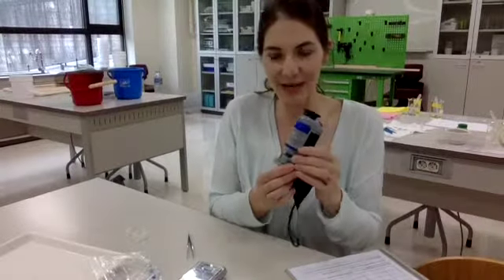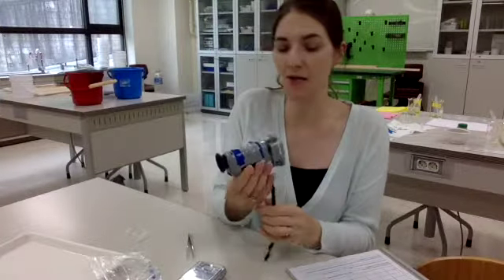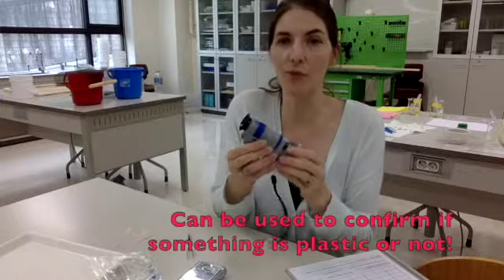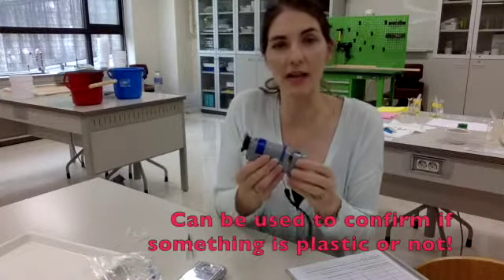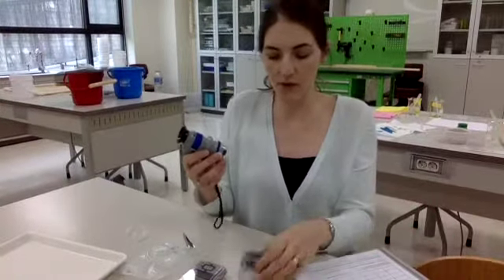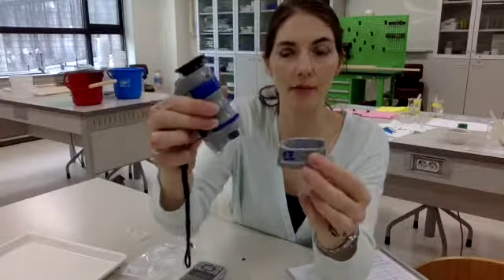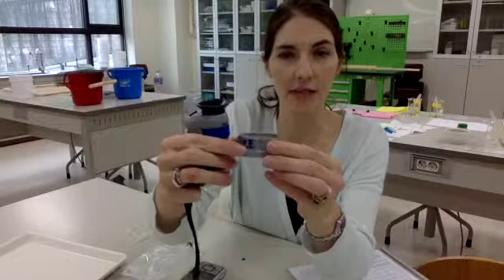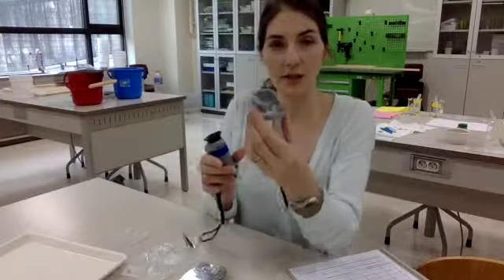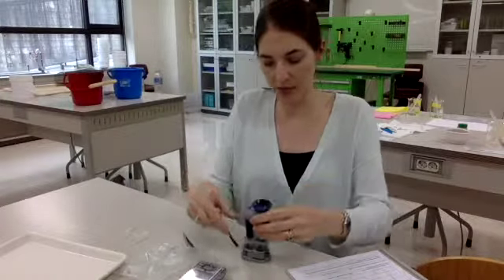The last thing that you might get to use if you want to see what your plastic looks like are these field microscopes. These are designed to look at items in the field. They're pretty hardy and can handle a lot, but we don't want to get them in the sand or get them too wet. Okay, let me show you how to use it. This bottom part comes off, and there's a place here for your sample to go. You can place your plastic sample there and then put this back on top.